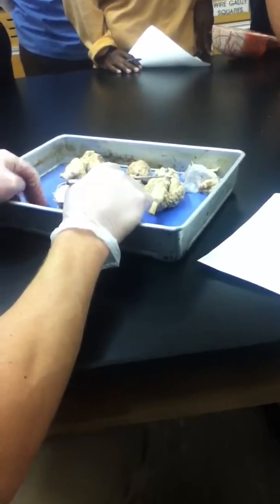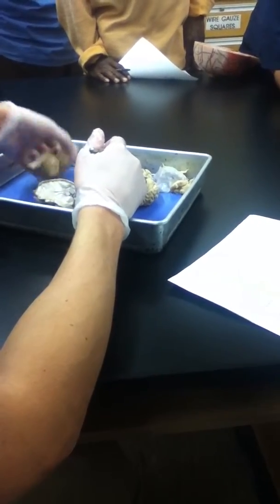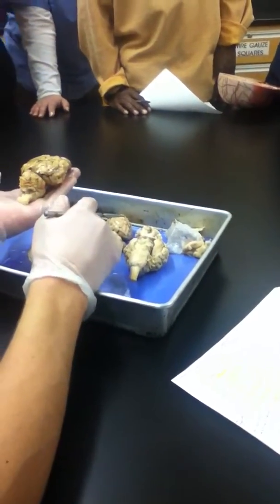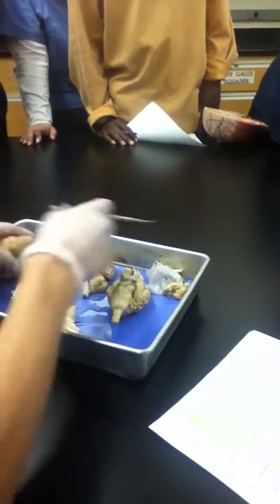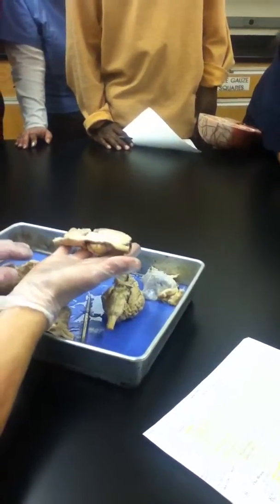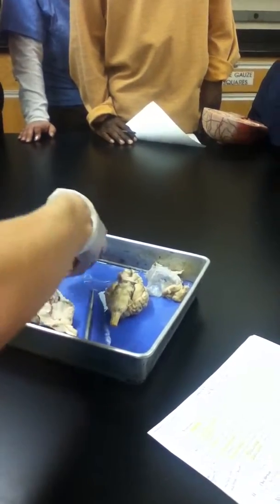At least a few stations on the next practical will be of the sheep brain specimens here. And similar to the brain plastic models, you want to make sure you understand what you're looking at from multiple different angles. Take, for example, there can be a specimen where you're looking at the brain from this angle, so basically a superior view. One from this angle where you're looking at it from an inferior view. One where it's half a sheep brain from this angle, so a lateral view. And one where it's, say, half a brain from this angle, so a medial, sagittally sliced view. So we'll go through each of those different angles.